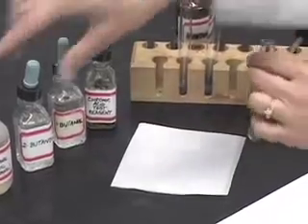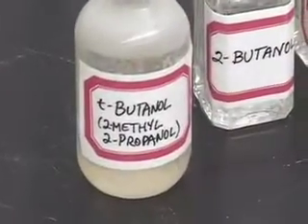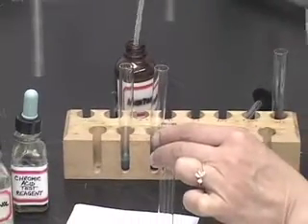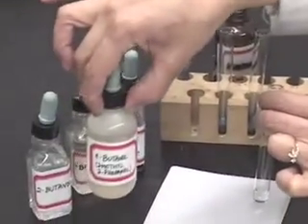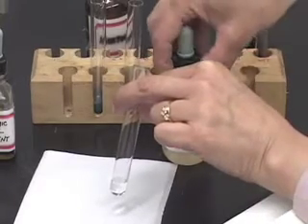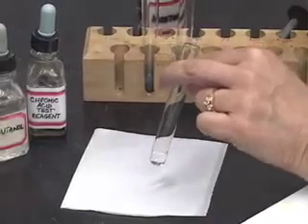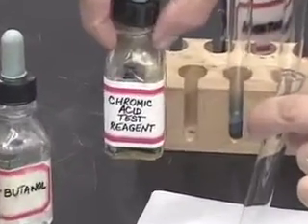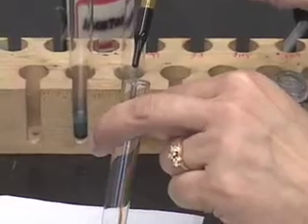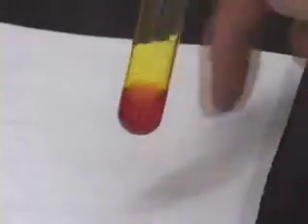I am going to now test T-butanol. T-butanol is a tertiary alcohol. So let us repeat the procedure by taking one milliliter of acetone, adding to it two drops of the test compound. Mix the two and then we will add two drops of our reagent, chromic acid. Let us mix it.